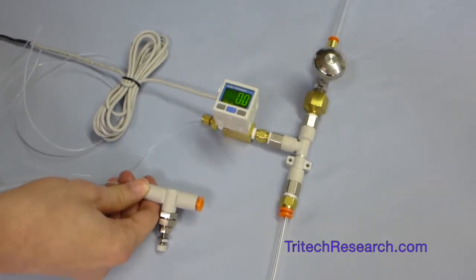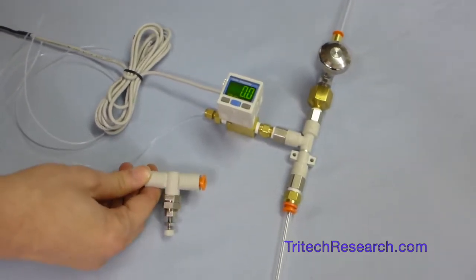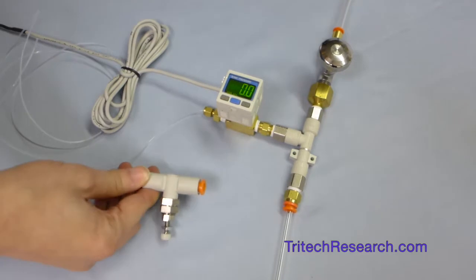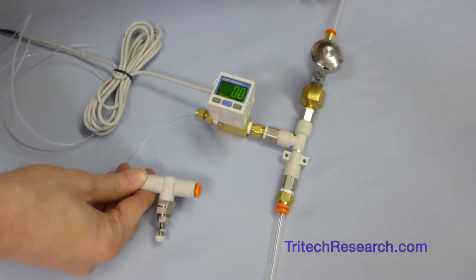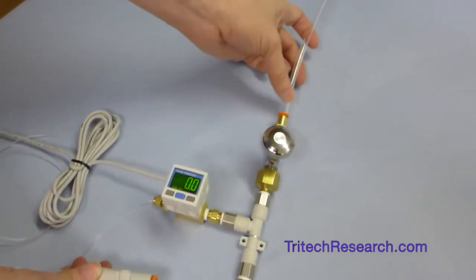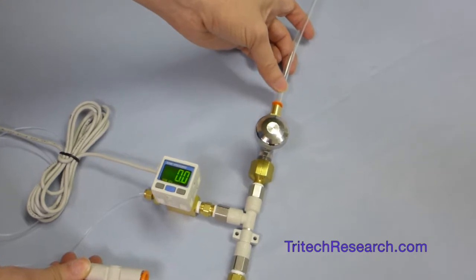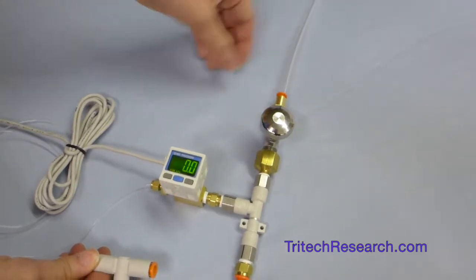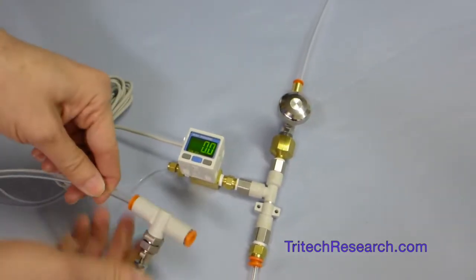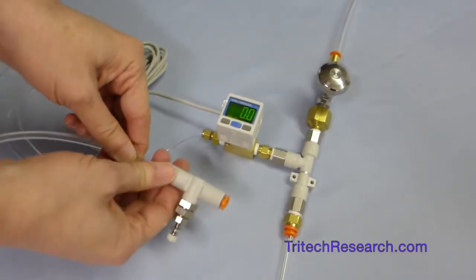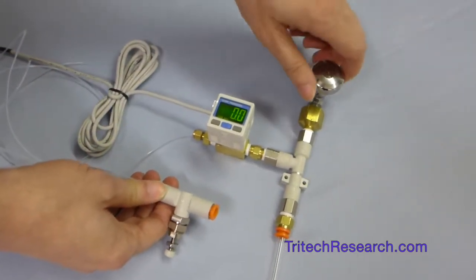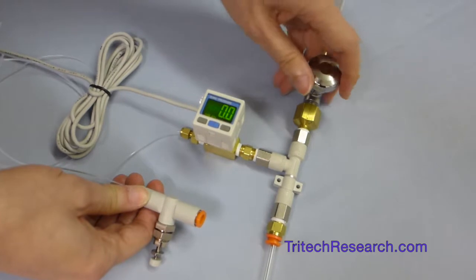All right, now I'm going to show this device creating a strong vacuum. So we have quite a bit of pressure coming into it here, about 80 psi, and this is open all the way so we're going to get the strongest vacuum we can get when we open the input flow control.